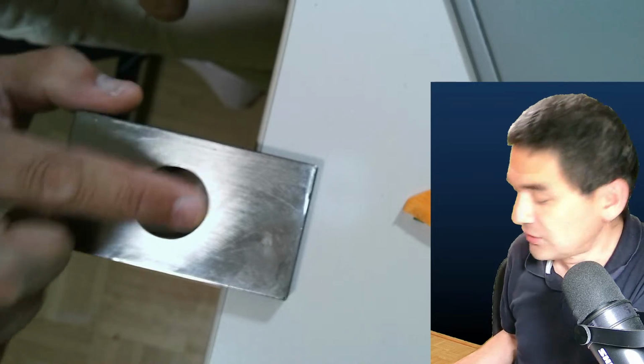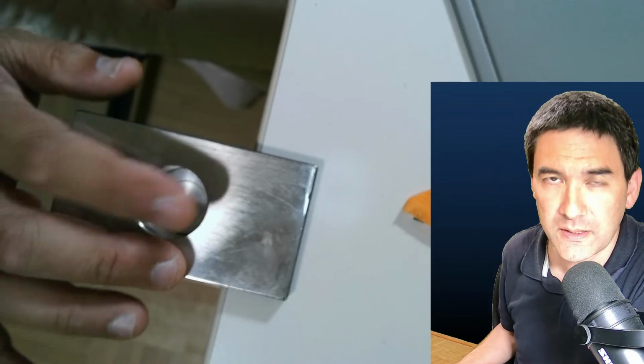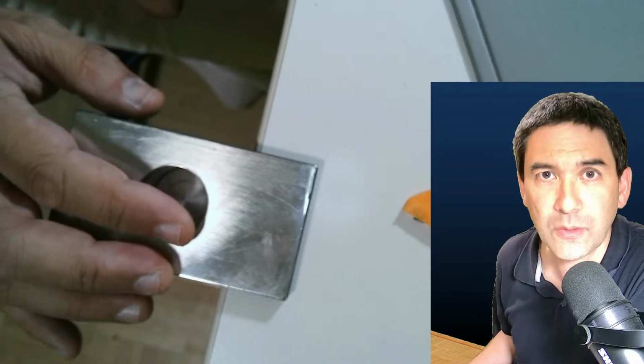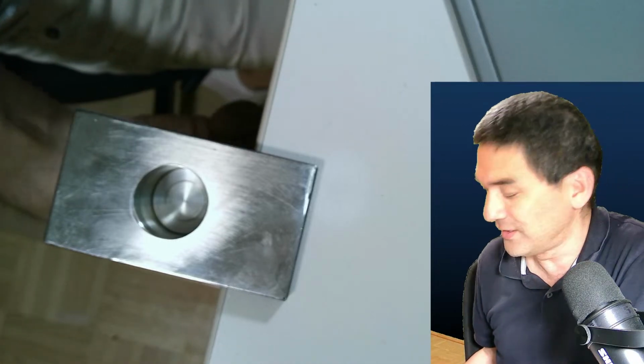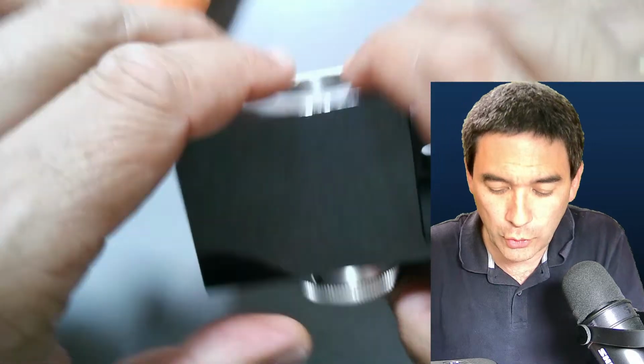And so this is one of the reasons why I was able to get slightly better cuts than with the other microtomes. But again, it also depends a lot on the knife. It depends a lot on other things as well. So what I'm going to do now is try to make a few microtome cuts using this microtome over here. I have to move this over again.